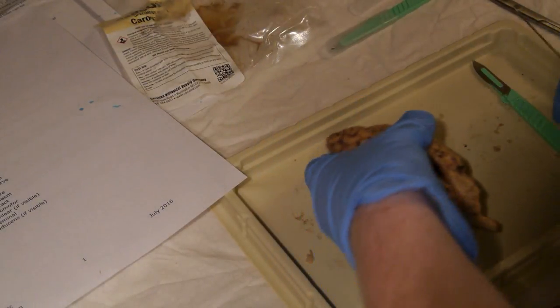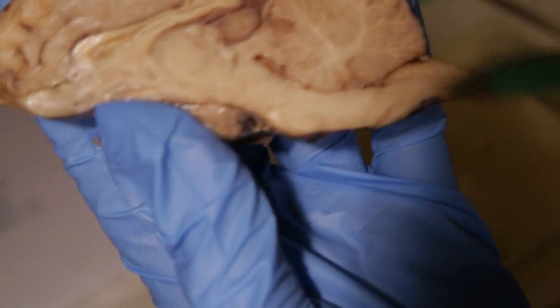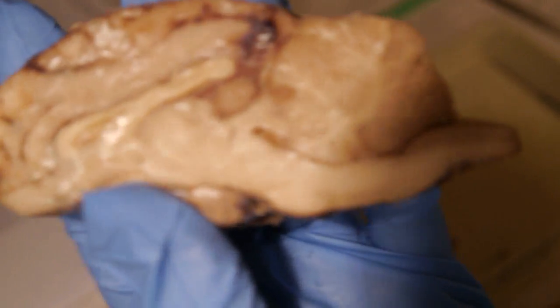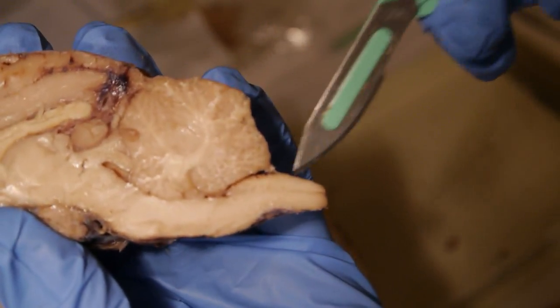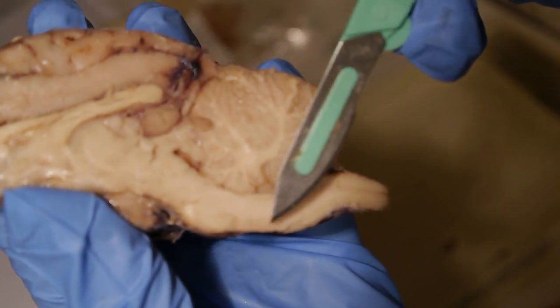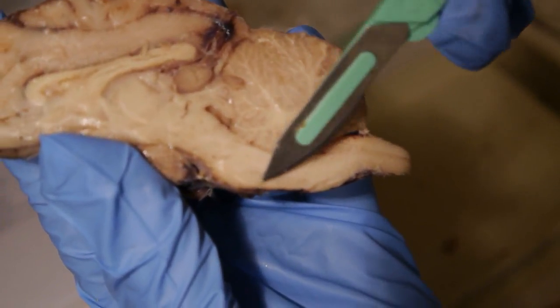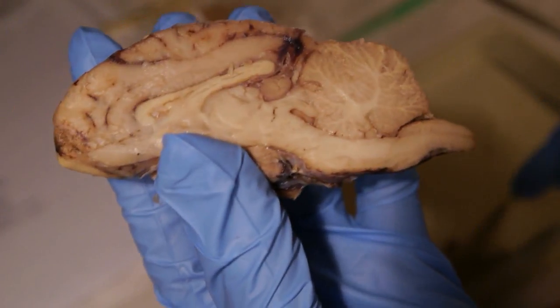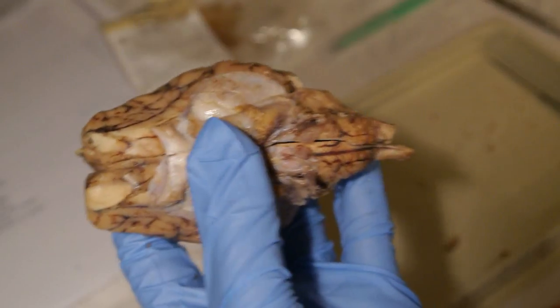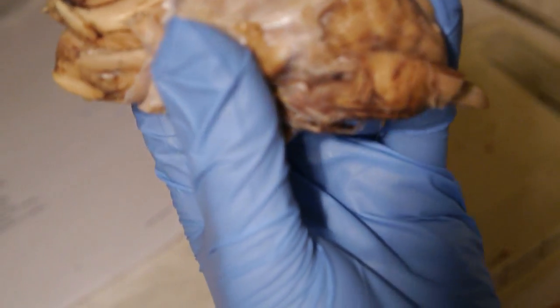Next we have our spinal cord, which, if we put our little brain back together, is this. And I'm supposed to be seeing white matter and gray matter, but all I can see is white matter in there. I don't see anything gray, unless, you know, this little line right there is part of our gray matter. And I don't see our dorsal or ventral roots as well.